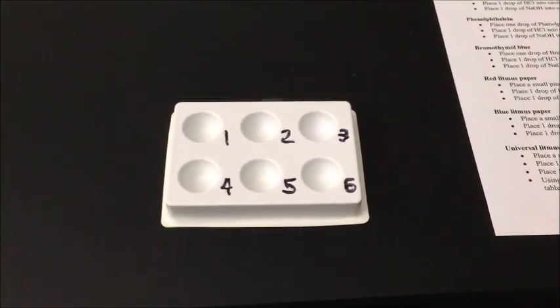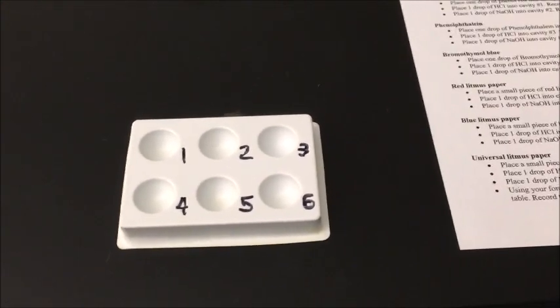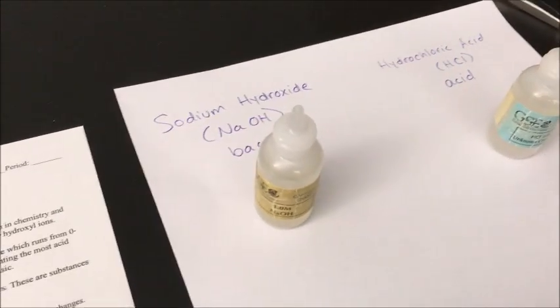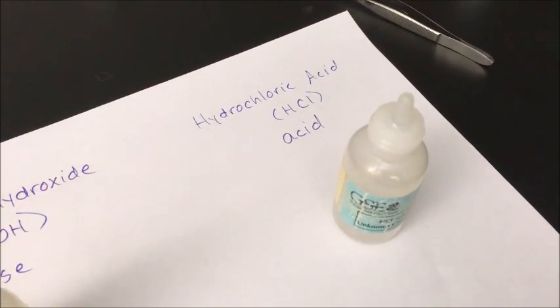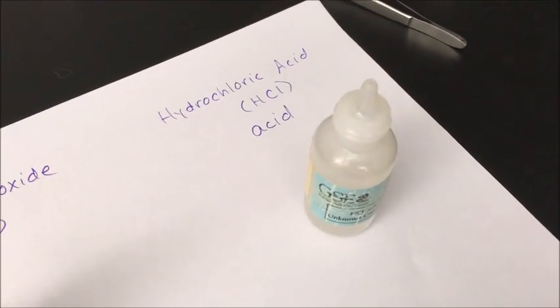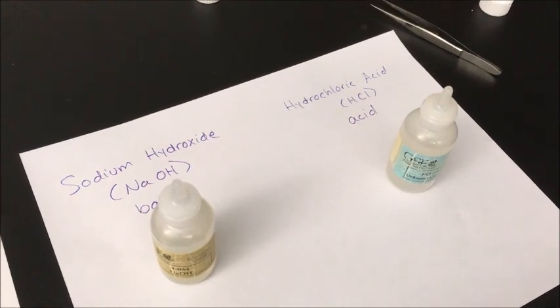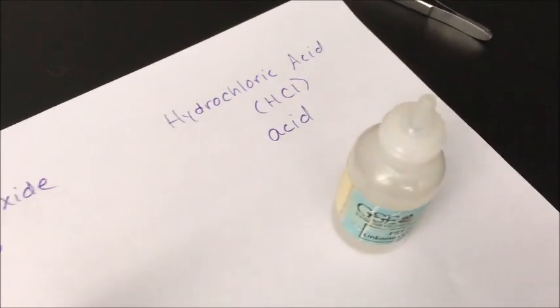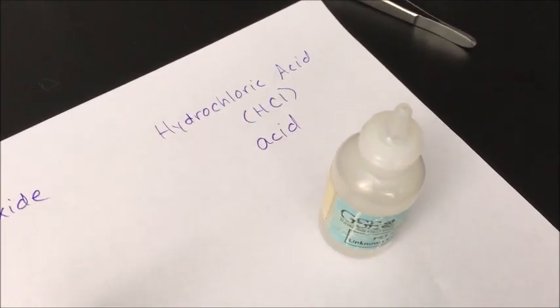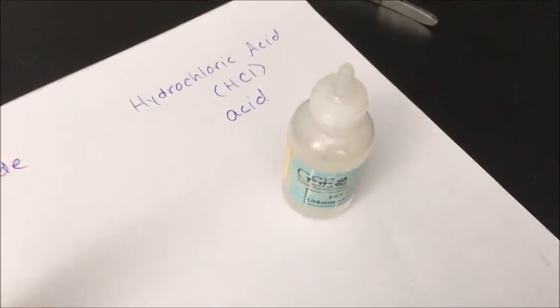This is the makeup video in case you were absent from class when we did the pH indicator activity. I have my lab handout. On the left I have sodium hydroxide, NaOH, which is considered a base on the pH scale. On the right, hydrochloric acid, HCl, which is an acid. The purpose of today is to test six different indicators.